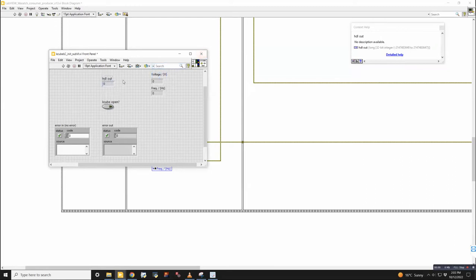And that's it. So you can use this for like an error case. Say there was an error in the connection and there was a -1 out, you could have some condition further down the line that checks to see if it's -1, and then it will shut down the software or take some other measure to try and fix that.